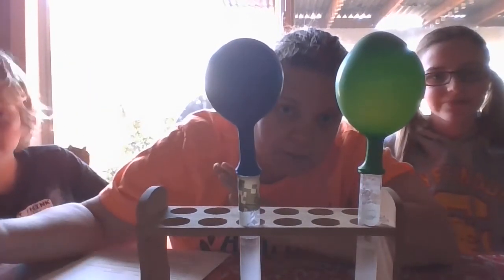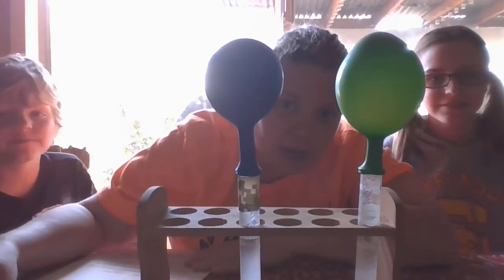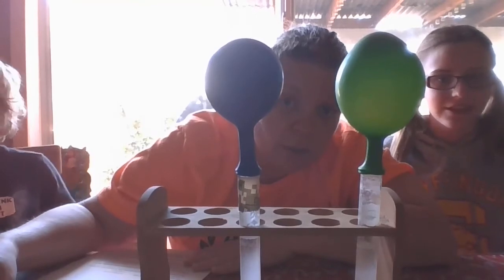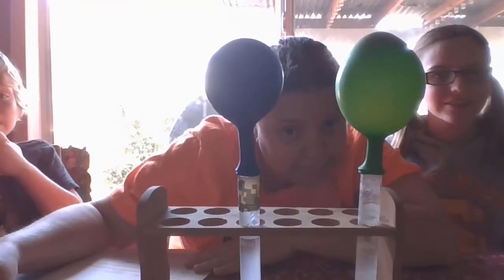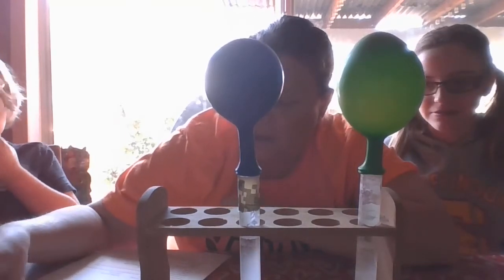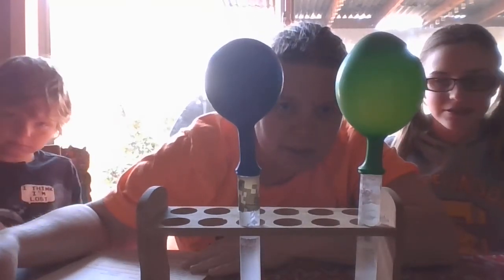So, answer your questions, pause the video. Go ahead and answer those questions because we are going to head outside to do something a little messy. It's called elephant toothpaste. So we're going to go and do this catalyst one. You can watch me.